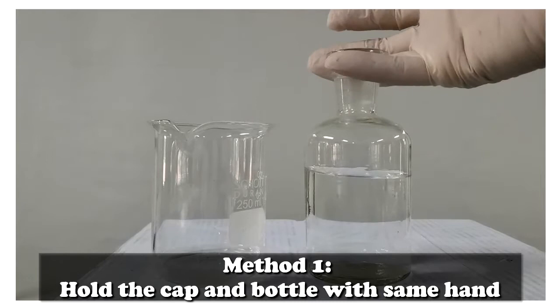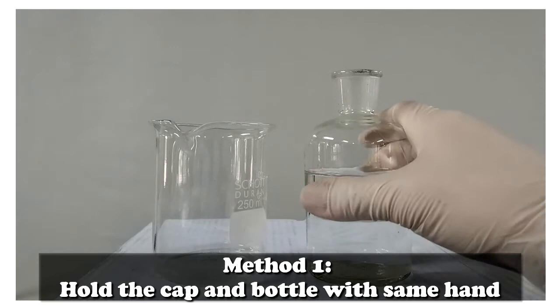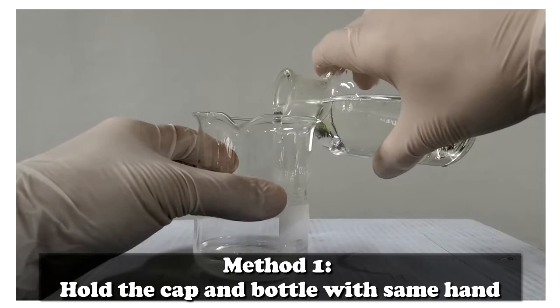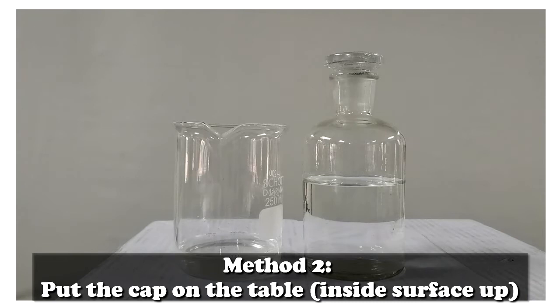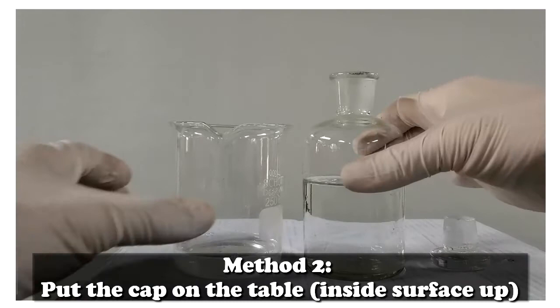Method 1: Hold the cap and the bottle with the same hand. Method 2: Put the cap on the table, inside surface up.